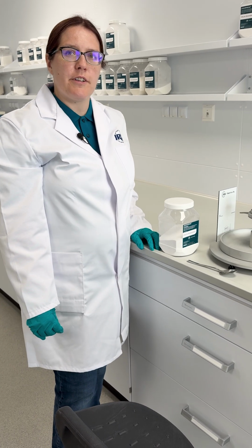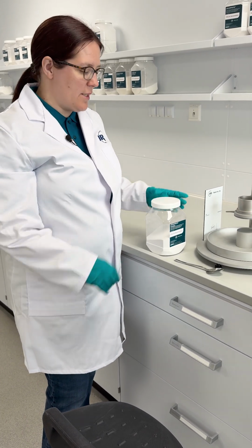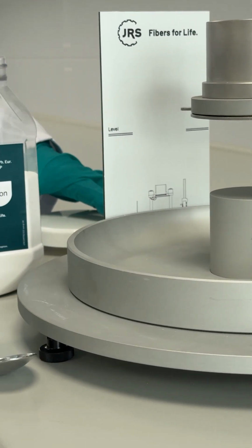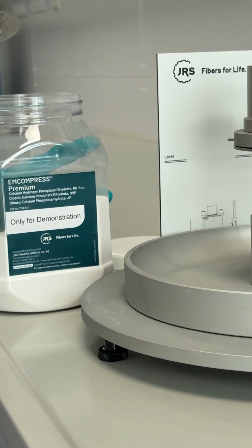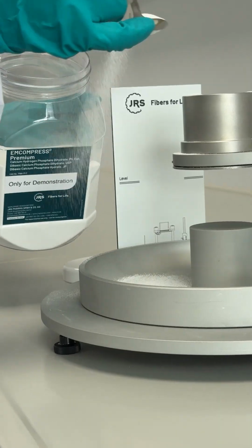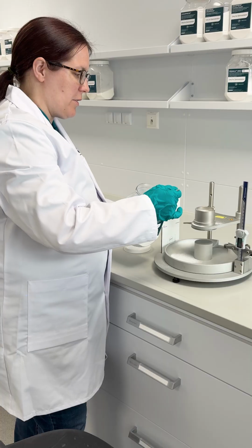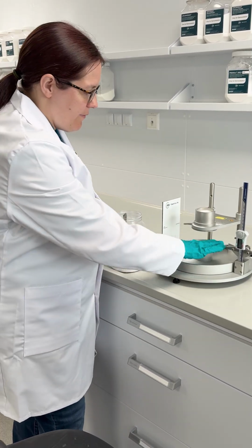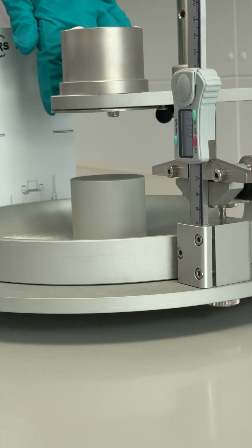Another method for measuring flowability is angle of repose. Here the advantage is you can get the information in a single measurement. We'll be measuring the angle the material forms on a pile. So this is an empirical measurement, so the distances and diameters are important, but you can get very excellent comparable data between materials with different flow characteristics.